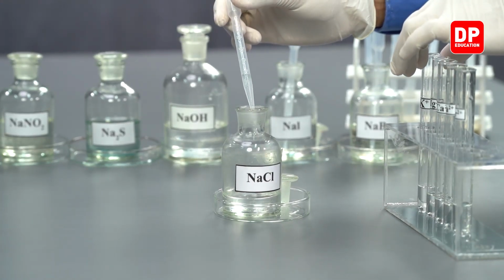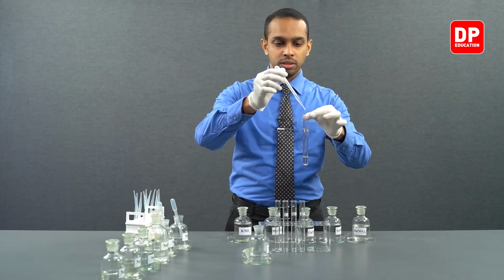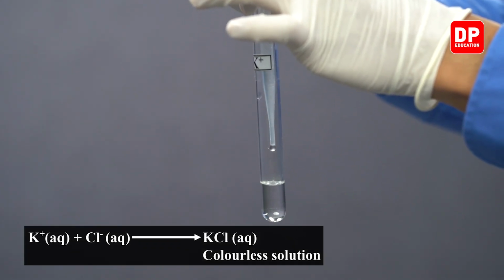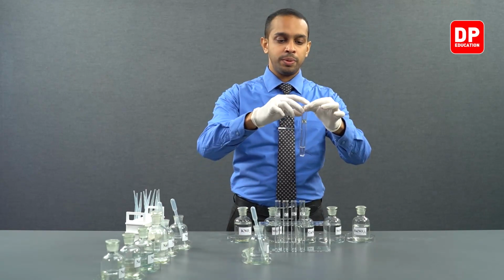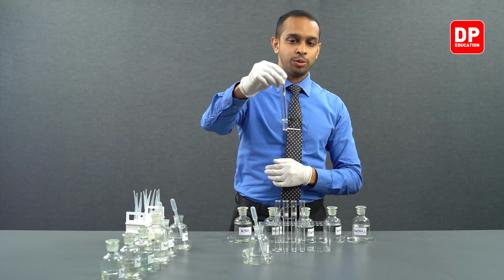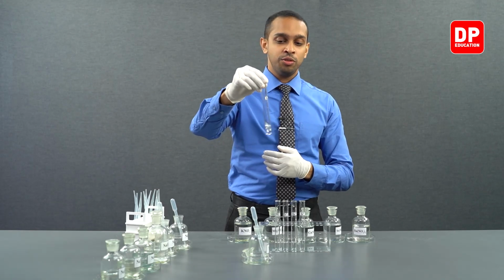We'll use a small dropper, and this is our potassium 1+ ion solution. Let's add a few drops of sodium chloride to see if a precipitate forms. As you can see, upon addition of sodium chloride into the potassium 1+ ion aqueous solution, we did not form a precipitate, as expected.